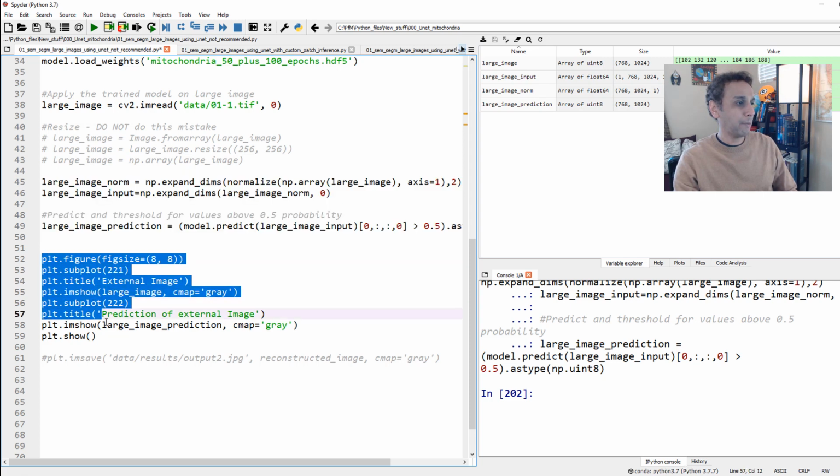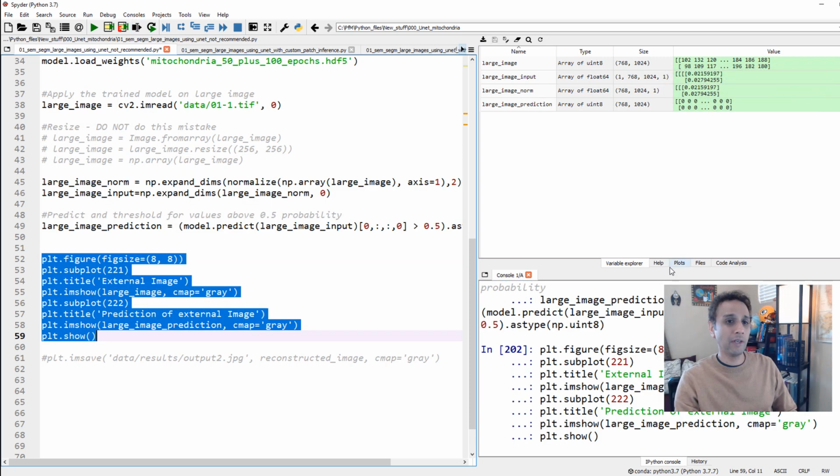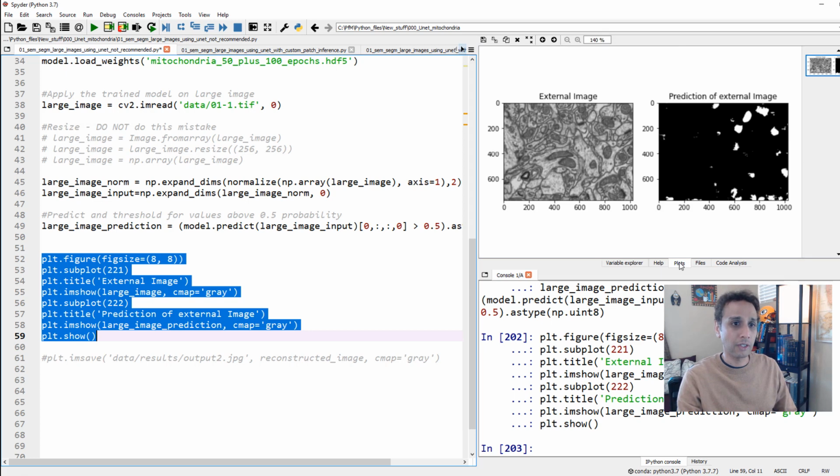And if you go ahead and plot it, you'll immediately realize how poor the results are. You see how my results look pretty horrible. That's because I'm applying weights from a network that has actually been trained on 256 by 256 size images onto a completely different size image here.